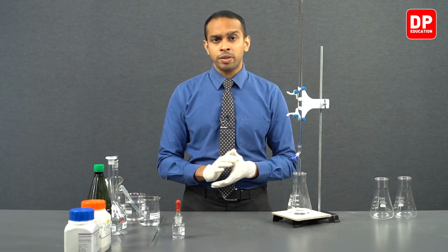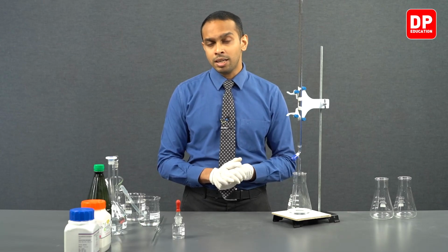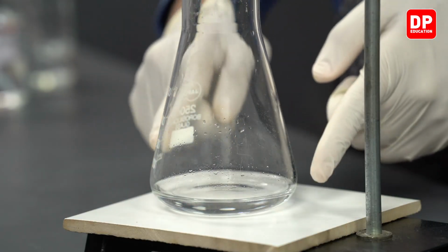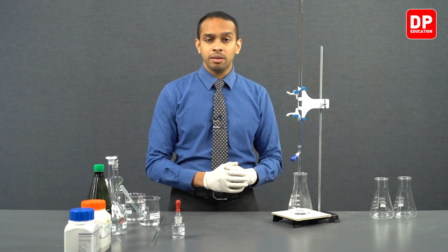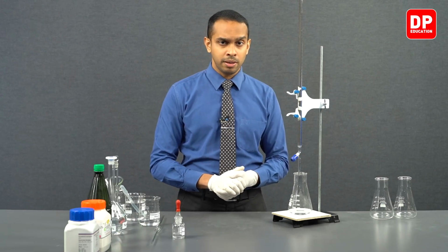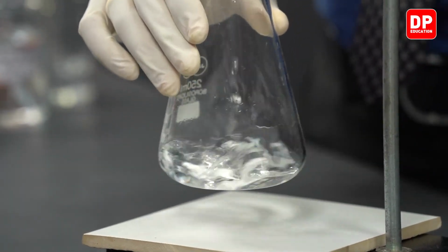After all of the acid is completely reacted, the next incoming drop of sodium hydroxide will turn this solution pink, because in a basic medium, phenolphthalein will display a pink color. So we are going to be carrying out this titration until we observe a pink color. Let's proceed to do that.